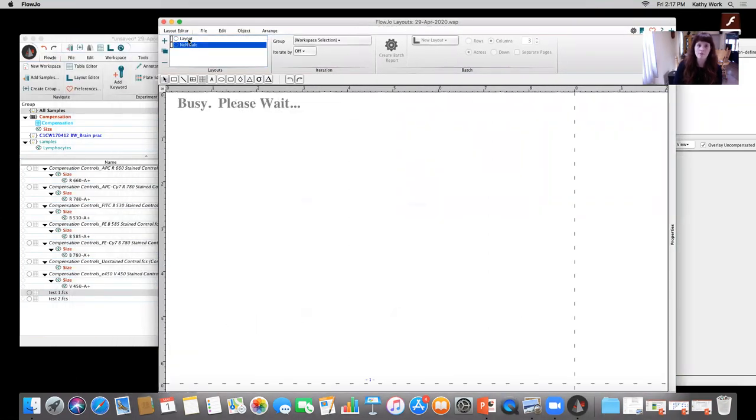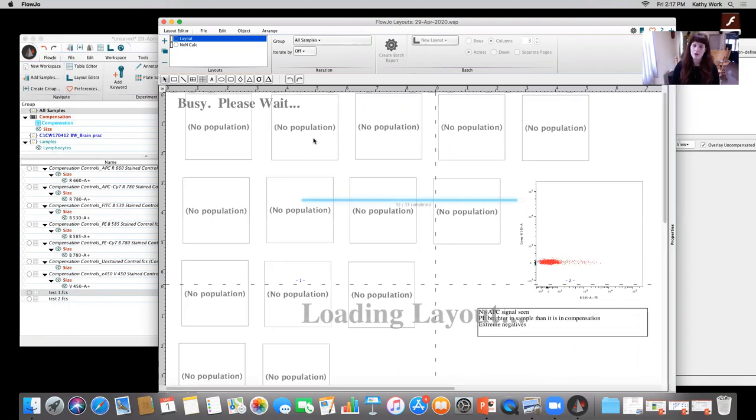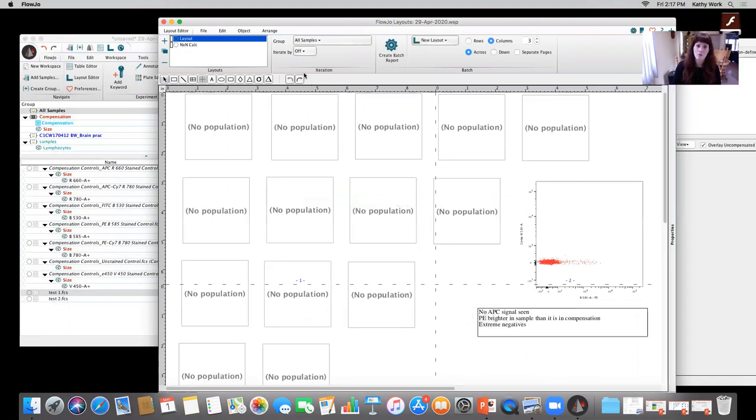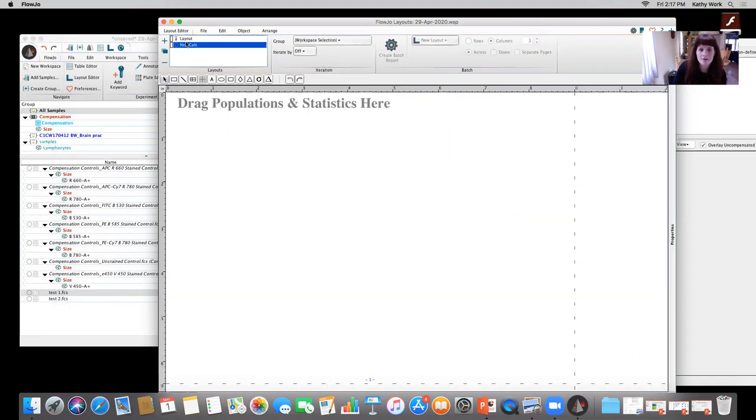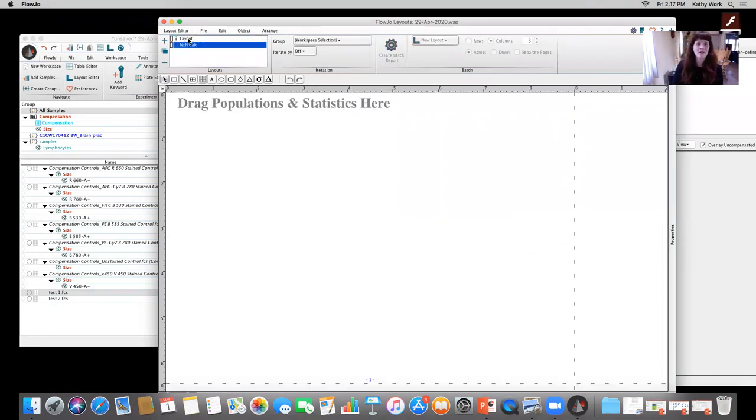And when you take a look at those N by N plots, clear way, right, in the layout editor, we can get a clear picture of what's actually going on. So for example, this one didn't work out. So you guys actually get to see an example of how I create that N by N plot.